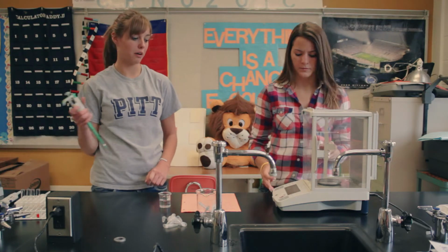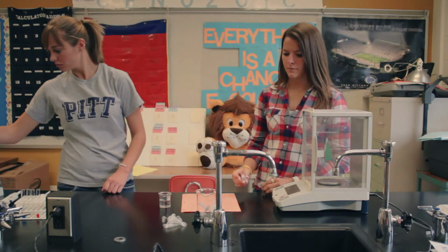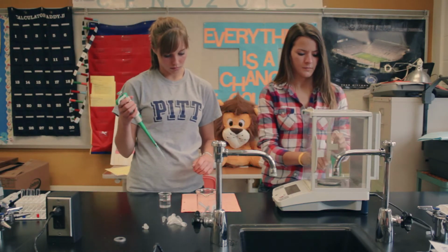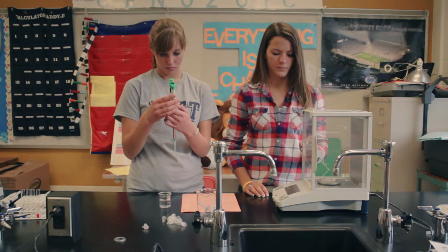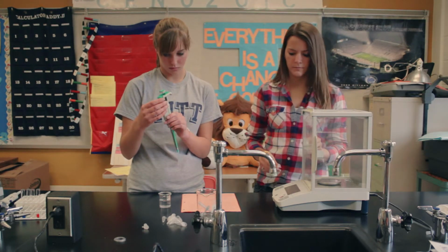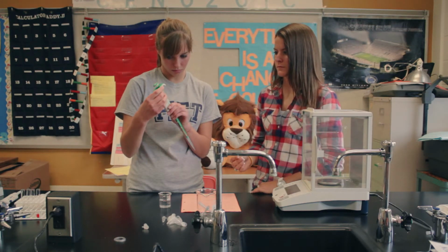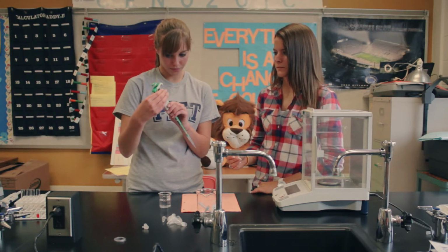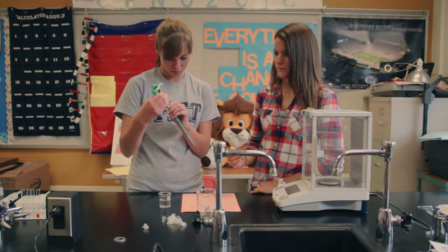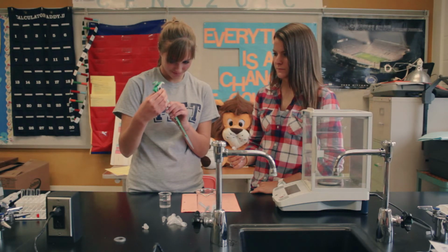What do you want me to do with the BioRad? We're going to do one more, and we're going to use the BioRad, and we're going to show you the same process one more time again. Massing out the empty tube. Now Maggie's calibrating the measurement. Maggie's very precise with the measurements.